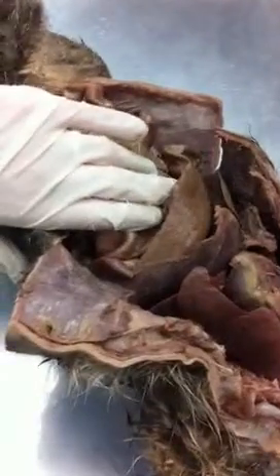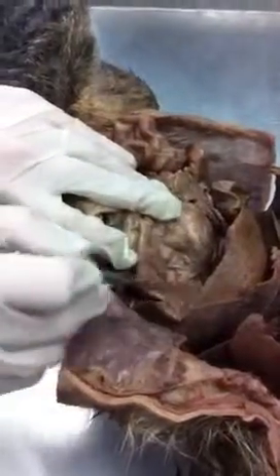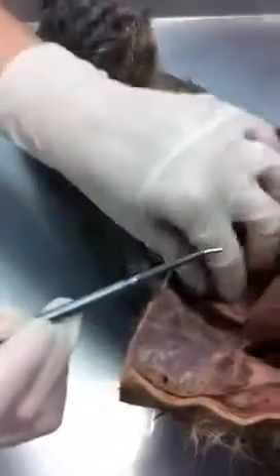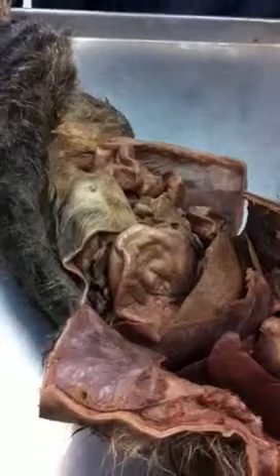What part of the small intestines? Duodenum. Duodenum. Okay? All right. So what is this structure here underneath the liver? You can stand up on the table if you need to. That's the stomach. Okay? This is the stomach here. All right? So let's talk about digestion a little bit. All right?